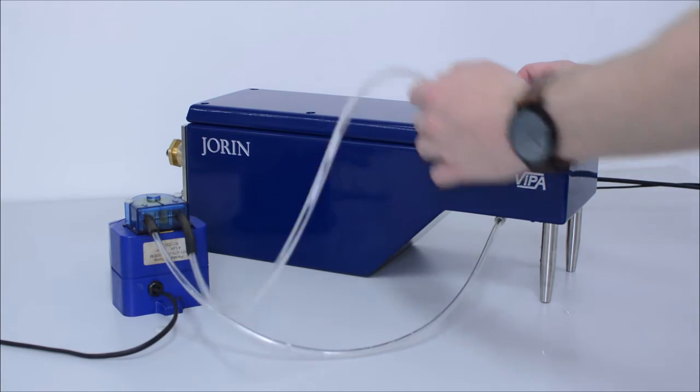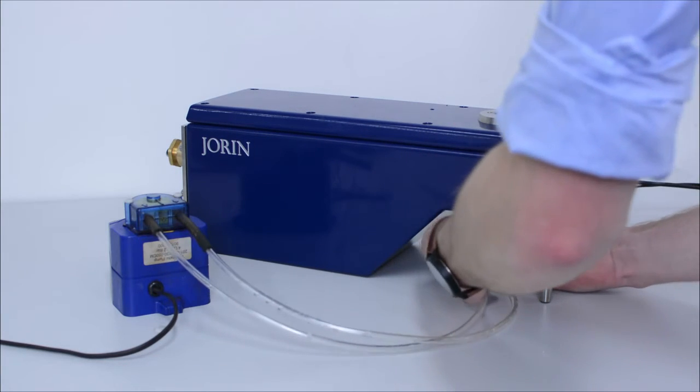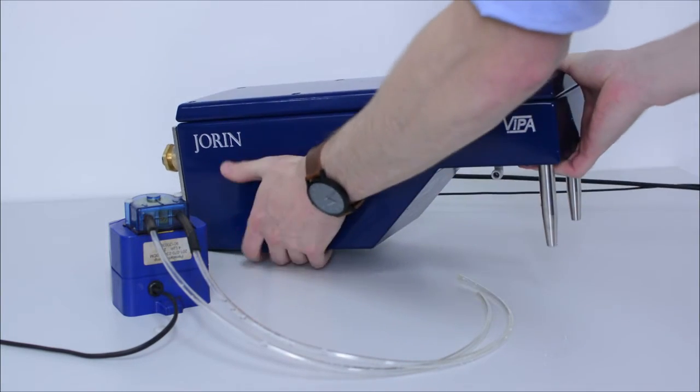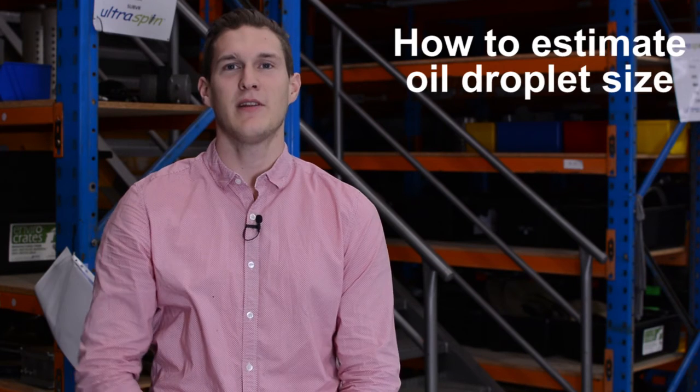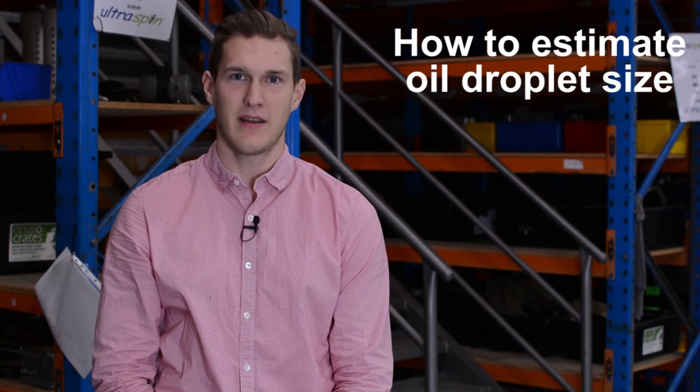The equipment that we're using today is highly portable and we can easily bring it out to site and test your oily water in the field. If you're building a new site and don't have any oily water to analyze, click here for alternate methods to estimate your oil droplet size.